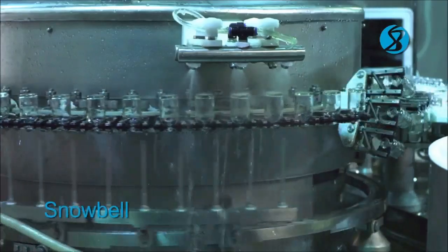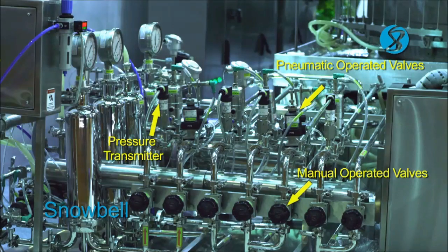The used cleaning media is collected in the integrated stainless steel tray and recirculated or drained.